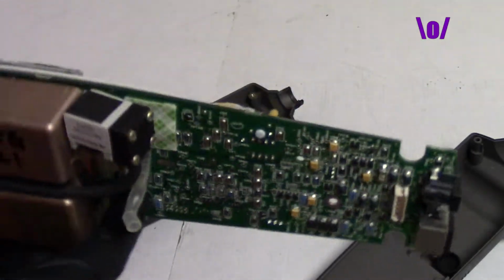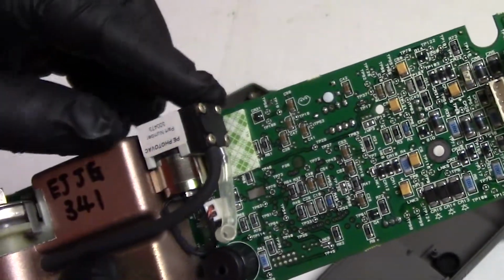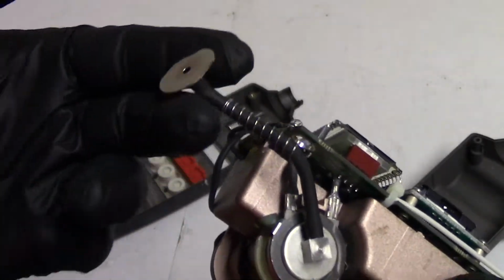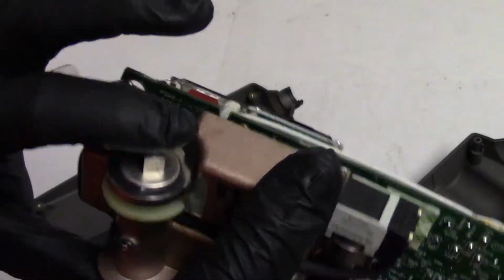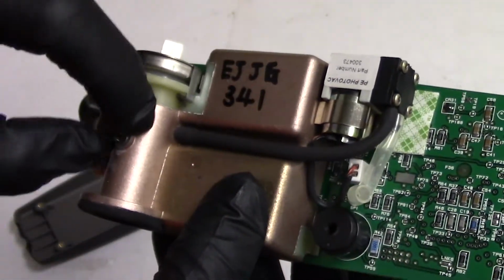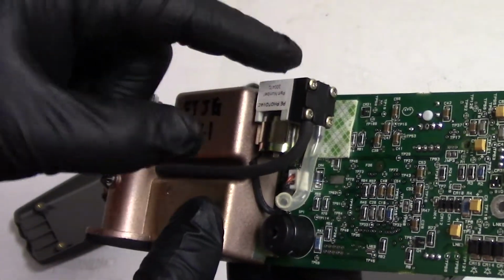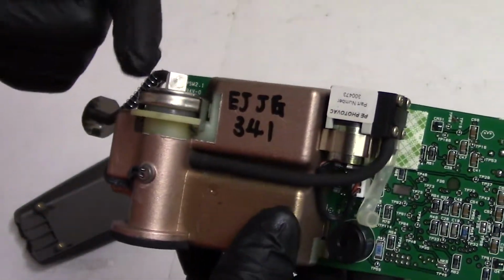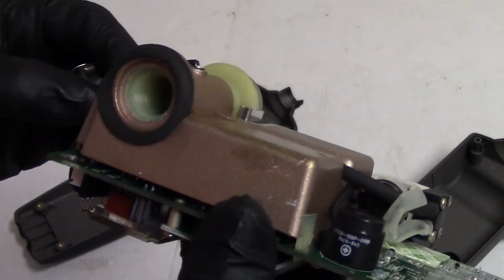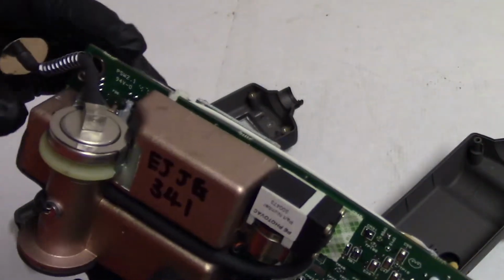And then as we move up, here is the pump. This is the air pump that pulls our sample in. That's where the sample goes in through that hose. You can see it goes into that detection chamber here. And then that hose goes into the whole thing, so the air is pulled in like that, then through the pump, and then exhausted out through there. This part is pretty straightforward and basic. There's not a whole lot going on.